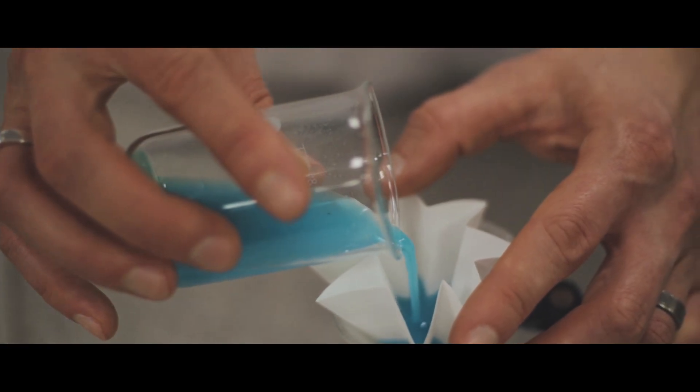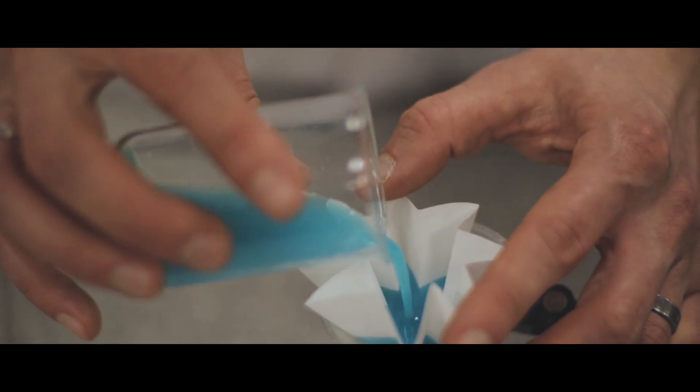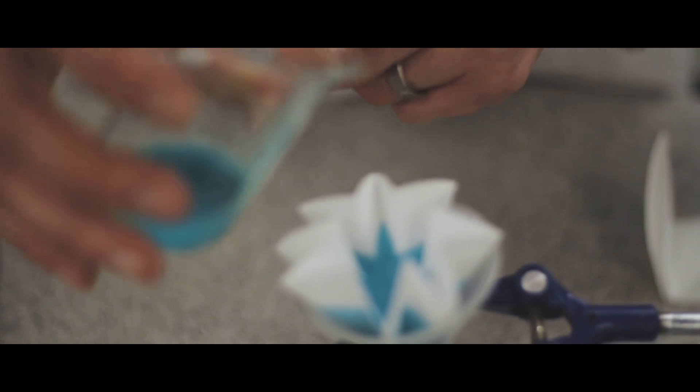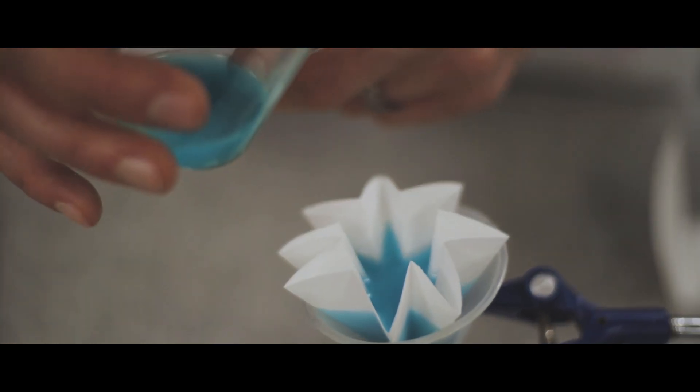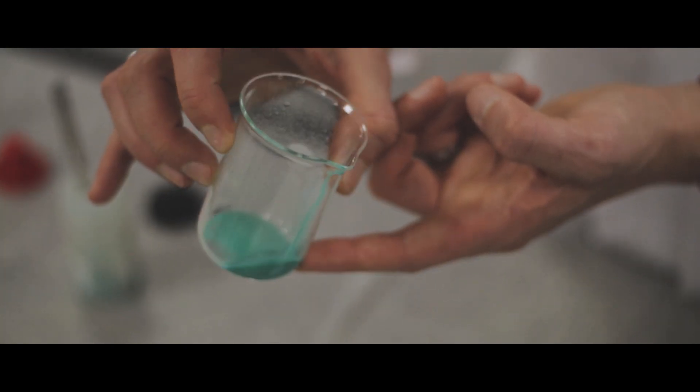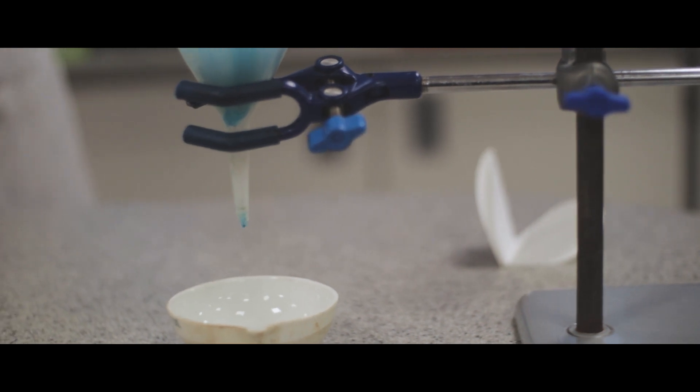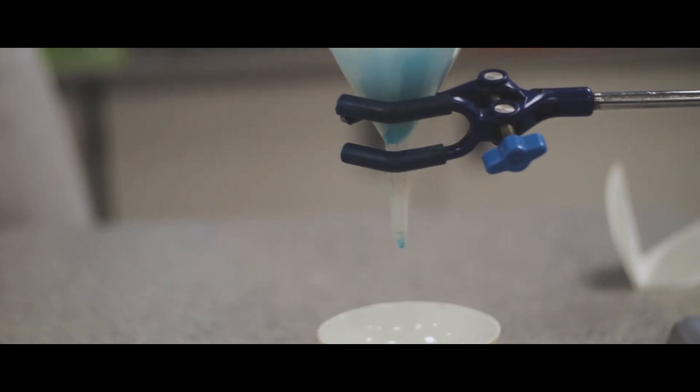So I don't want the solid, so I'm going to try and decant, which is another technique, the liquid across and just leave the solid in the bottom of this beaker. So there we go. Most of the solid is left behind. That's what we don't want. And then hopefully we're going to get the liquid dripping through into the evaporating basin.